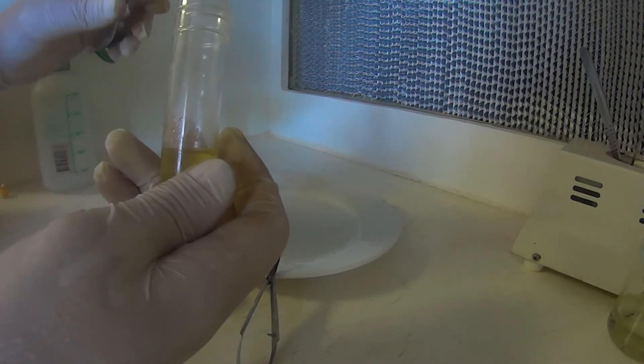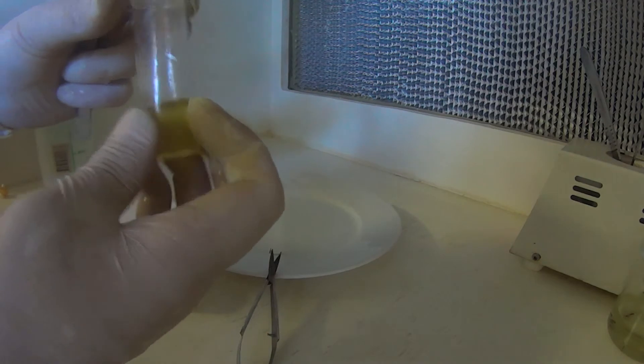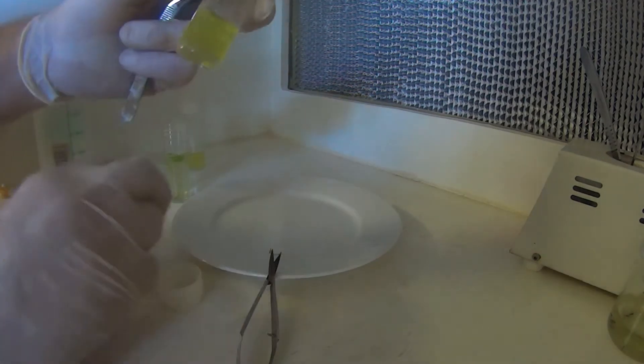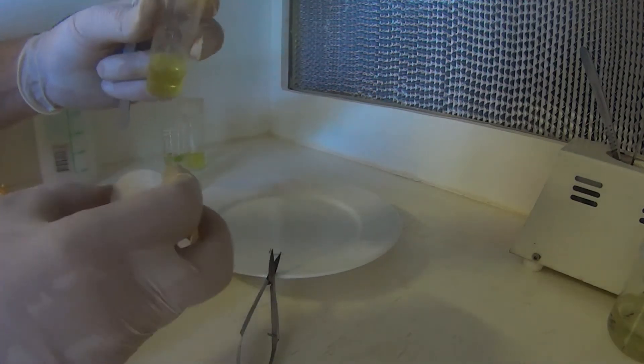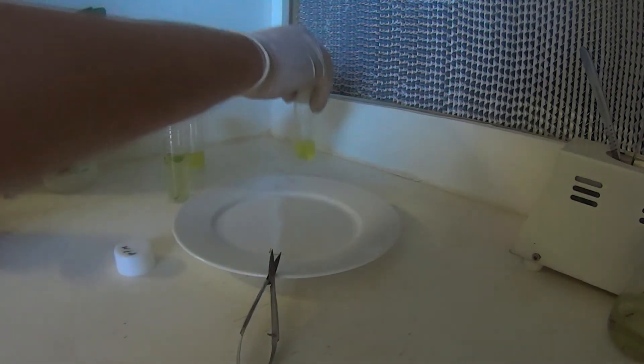Can be a little bit tricky. Try not to squish it any more than we have to. But it's laid down fairly flat in there. So, I'm happy with that. There's one.